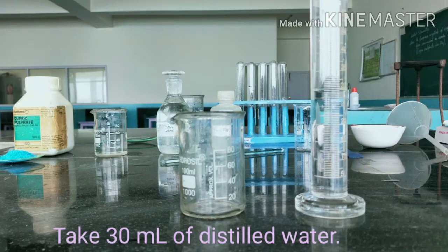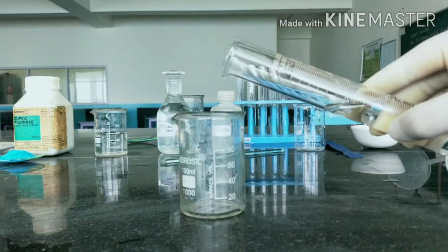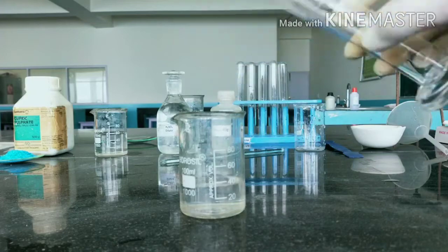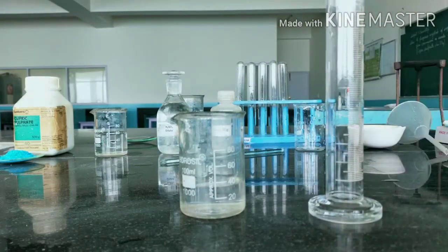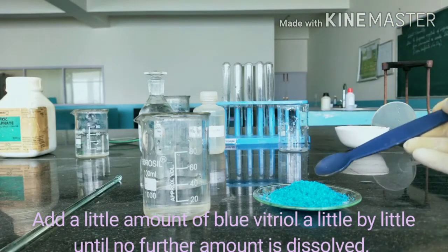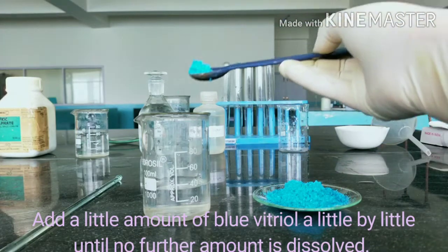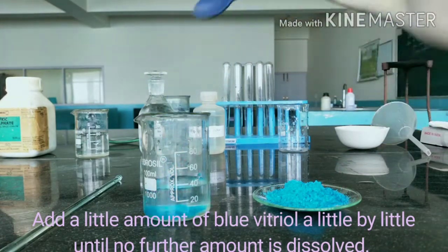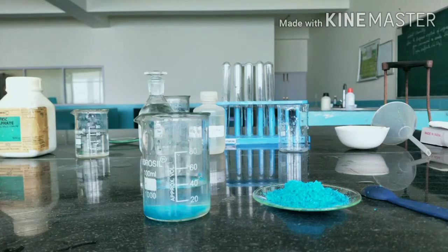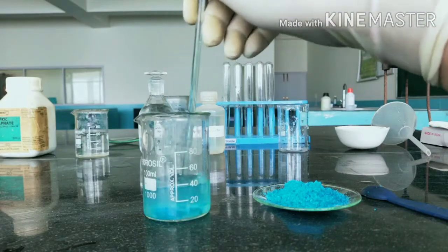First of all, we will take 30 ml of distilled water and put it into the beaker. Then we will add 1 spatula full or half spatula full of copper sulphate into the water. And we will mix it with the help of a glass rod.